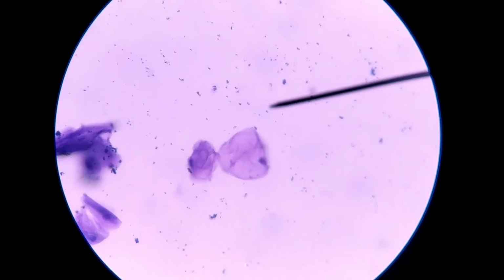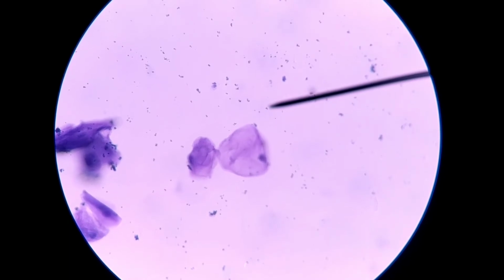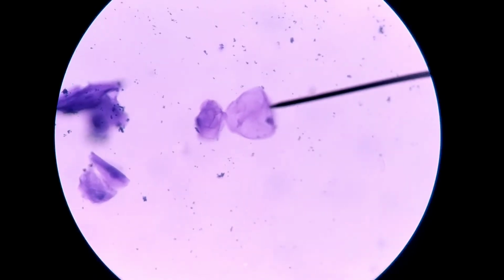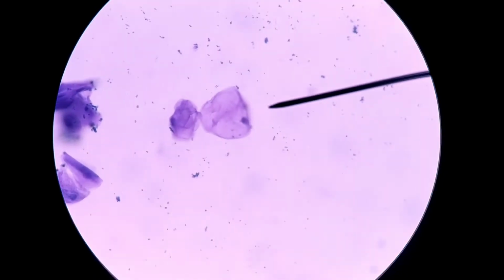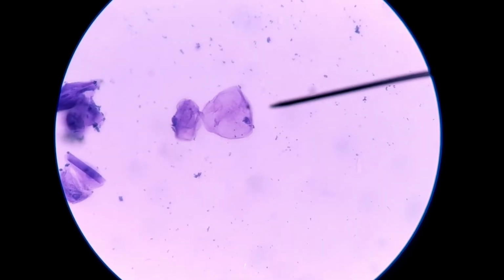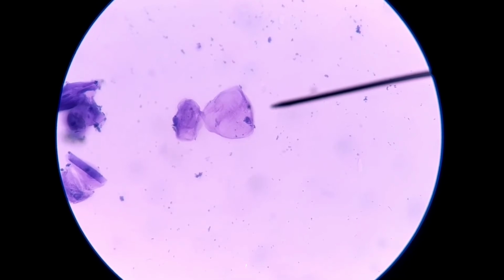Now we're getting into a more detailed situation here. So here's a cheek cell that turned out pretty well. That was a fairly crude way of biopsying, right? I mean, ripping them off of your cheek like I did isn't something that's going to produce all perfect results. But this one's okay.